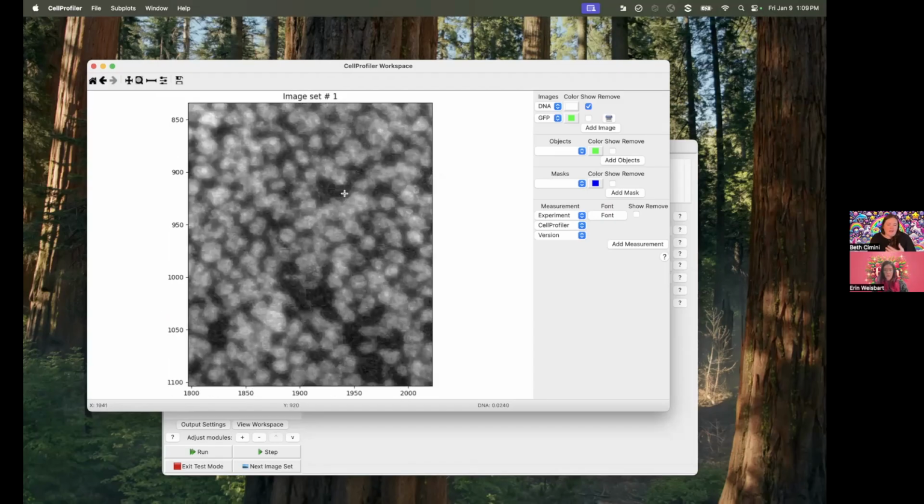So in zooming in, I have a couple thoughts in general. The first is that these are stitched, and when they were originally sent to us, they were sent as JPEGs. If I were going to be segmenting and counting these, I would probably just use CellPose rather than CellProfiler segmentation. CellPose inside CellProfiler is totally a thing you can do, but when stuff gets this crowded, CellProfiler segmentation is often going to be not ideal.